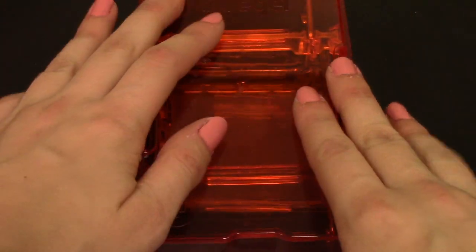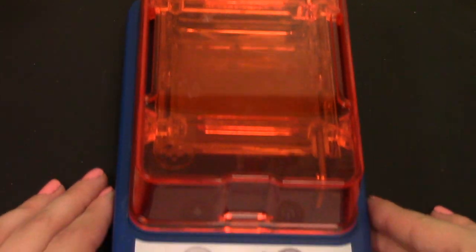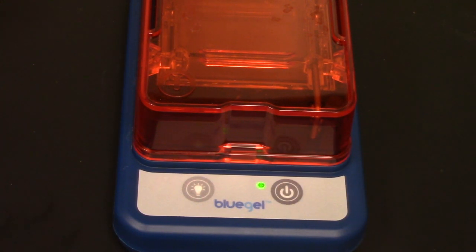Now I am going to put on the lid, which again lines up so that you can't run it the wrong way unlike other gels, and then I'm going to press the power button and let it run for about 45 minutes.